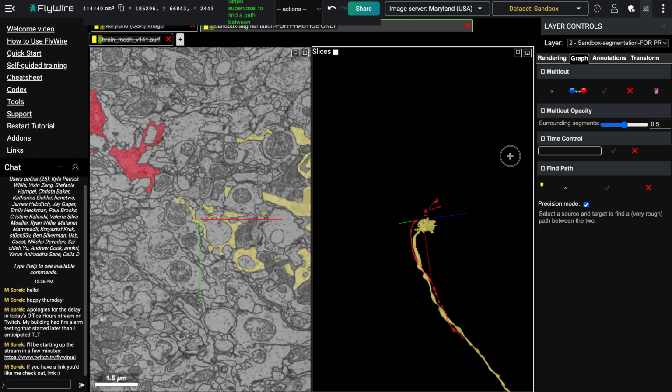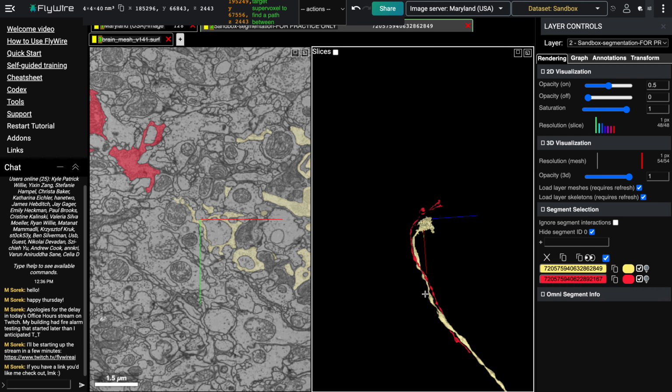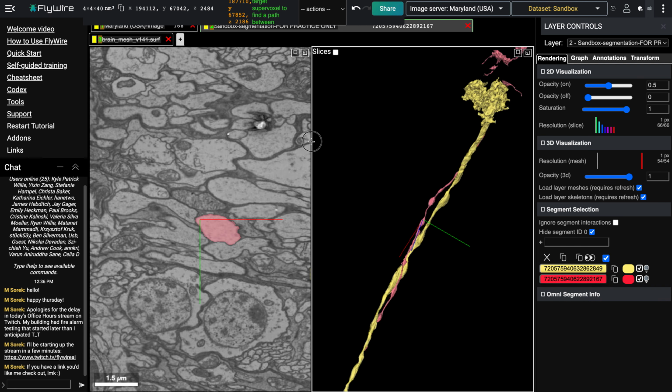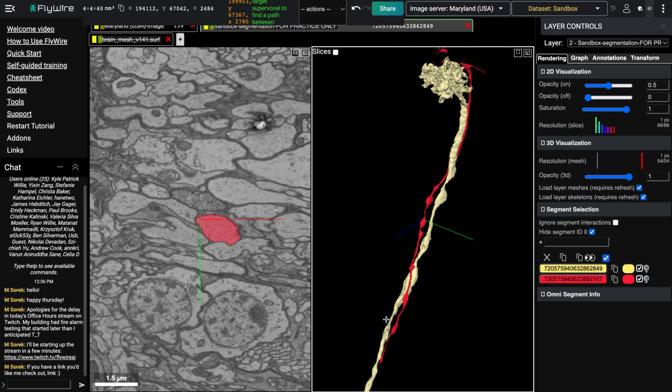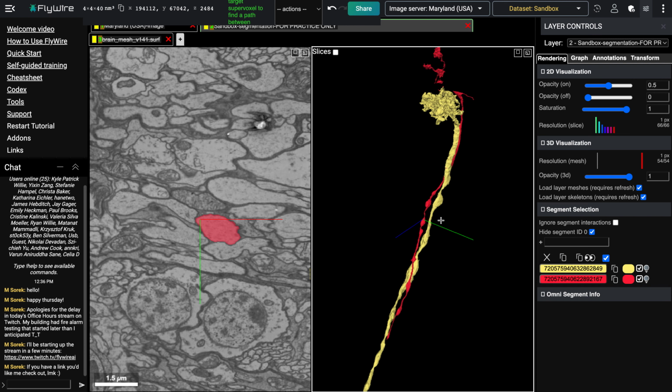Let's get rid of find path and turn the opacity up, and we can see here that we've got two separate neuron branches, and we can trace whichever one we were looking at completely now that they're disconnected.